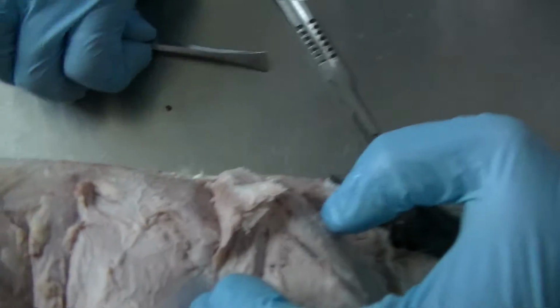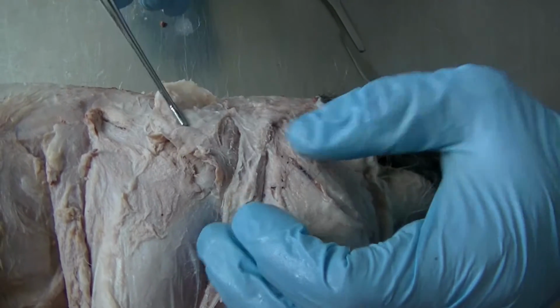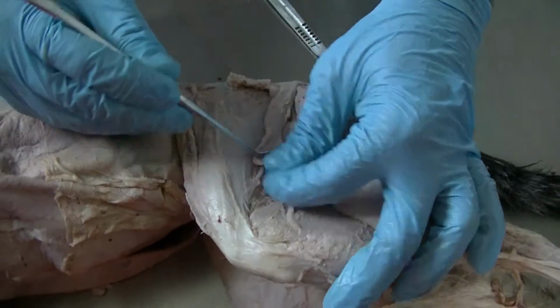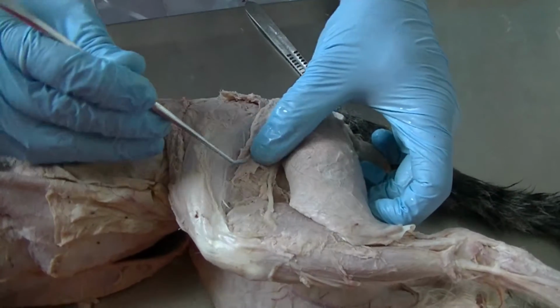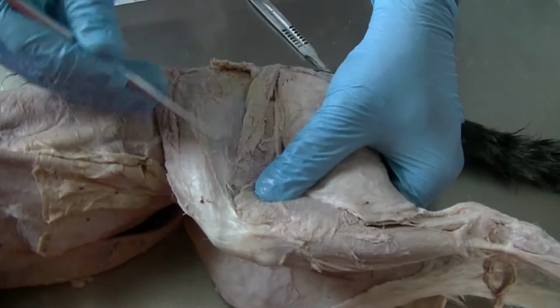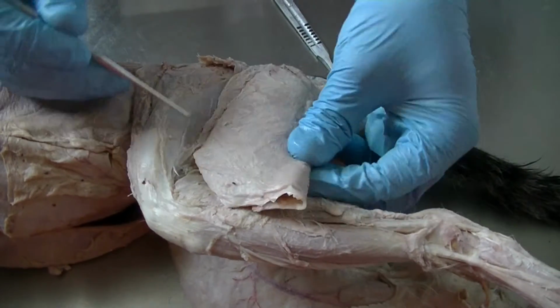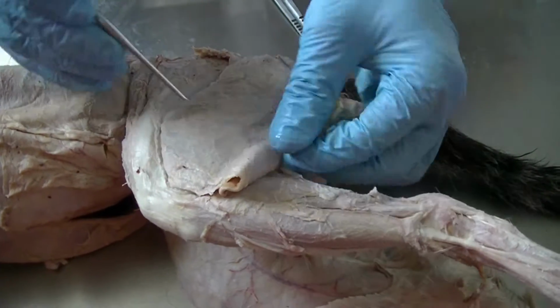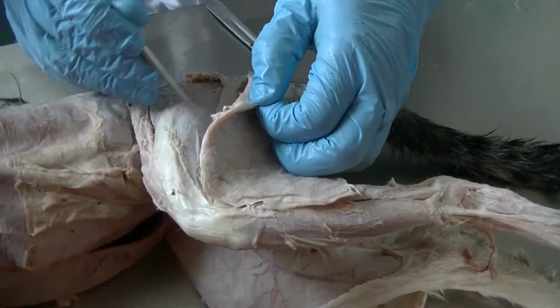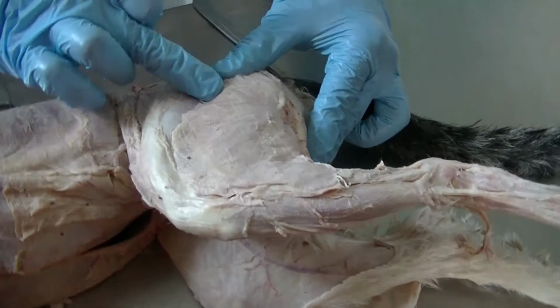The middle gluteal muscle, the superficial gluteal muscle, and the cranial crural abductor. The cranial crural abductor continues further and its aponeurosis joins the tensor fascia lata. So it becomes part of the tensor fascia lata. So this is your cranial crural abductor, which is partially covered by the biceps femoris. As we go deeper, this muscle continues further into the fascia lata. The biceps femoris, usual structure.